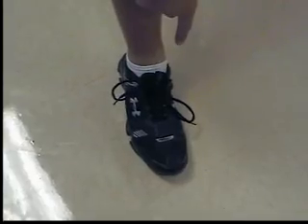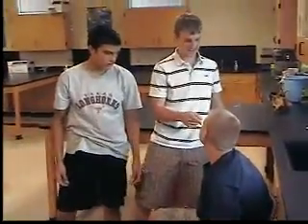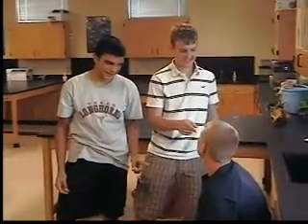Always wear your safety goggles. Smile. Always use protective footwear. Never drink the substance. And always waft to get the smell. And definitely no horseplay in the lab. And definitely never do an experiment unless your teacher tells you to. Especially if he looks like Nick's dad.